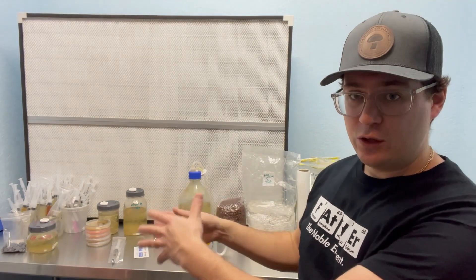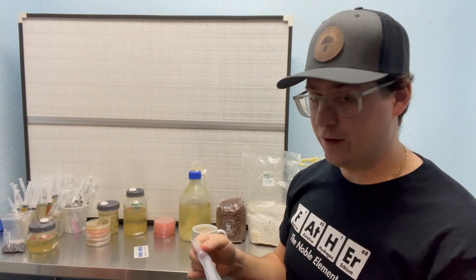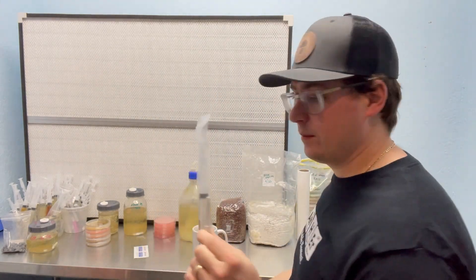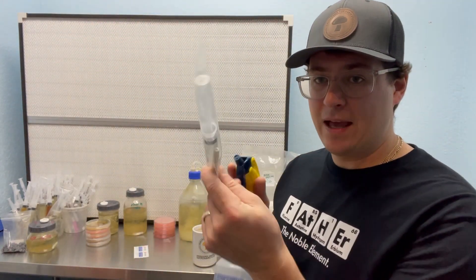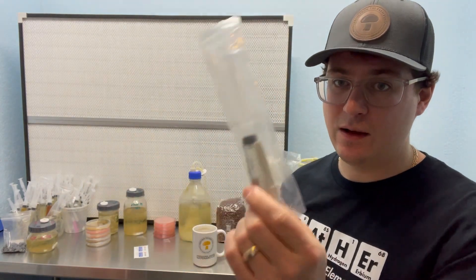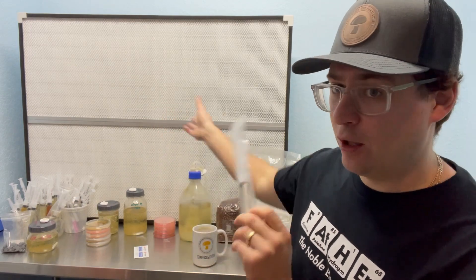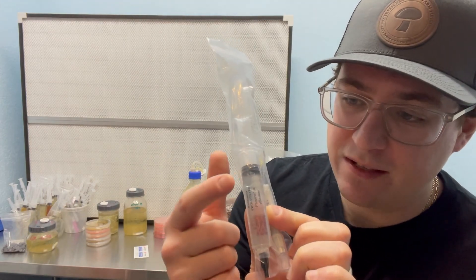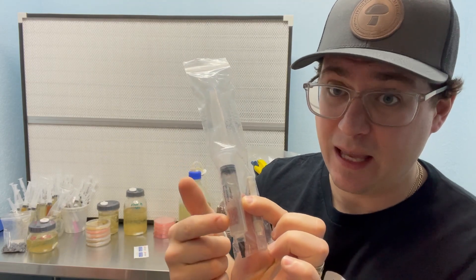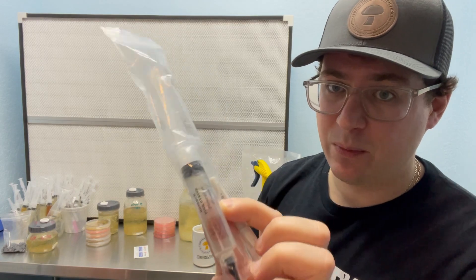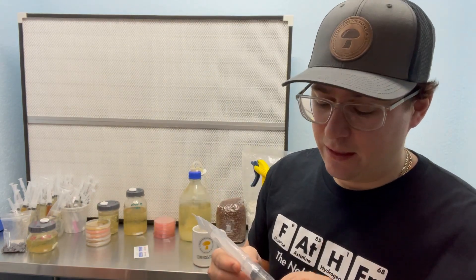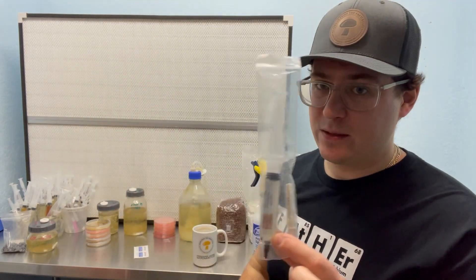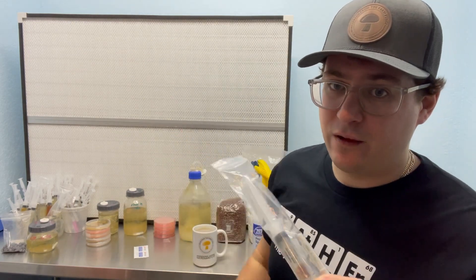So like I said earlier, there's a few different things that you can do with a liquid culture when you receive it. The first thing I would recommend doing is just spraying it down with some isopropyl. So I've got my alcohol here, and then that way when you're taking your liquid culture from the mail into your laboratory, you have a clean system. So I use gloves and a flow hood to prepare these liquid cultures. So I know they're sterile once they come out of this bag. One problem that some people have is if you spray off the actual syringe directly, you can wipe that label off. So be careful not to spray alcohol on these labels. I may upgrade to some fancier lab labels. But in the meantime, I'm just using these printed labels. So be careful that you don't wipe those off. It's not the end of the world if you do that, you can just label them yourself, but it is a heads up.